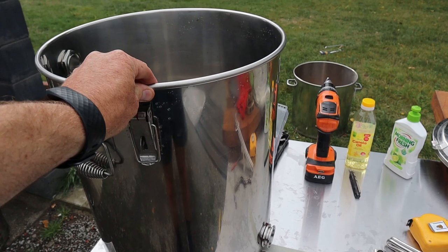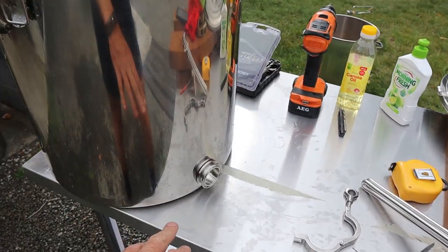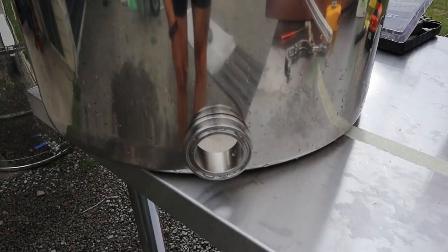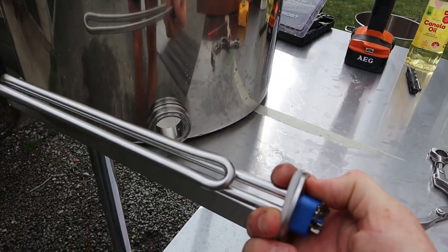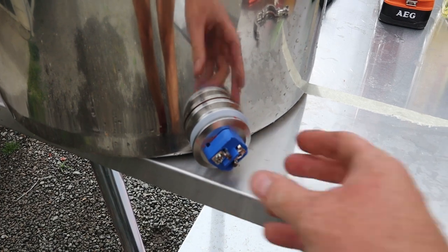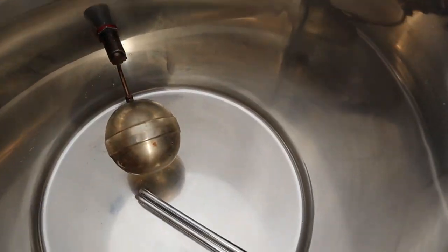It comes with a strainer for honey frames if you know much about beekeeping, and it already had a hole drilled in the bottom. It fit near perfectly — I just replaced that with a tri-clamp fitting. I got a 2500 watt element which sits straight through and mounts in there with a tri-clamp fitting that squeezes it in at the bottom.